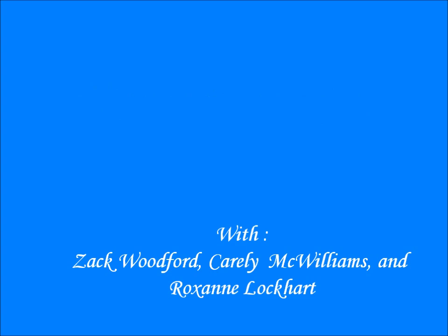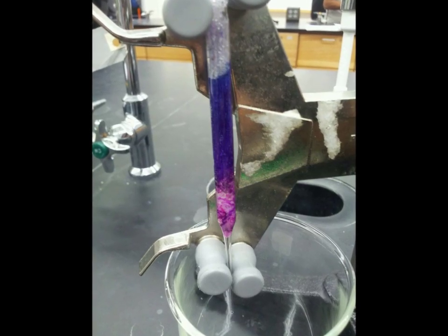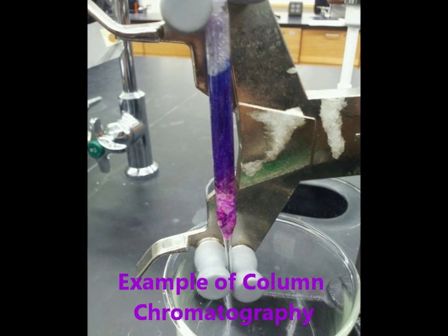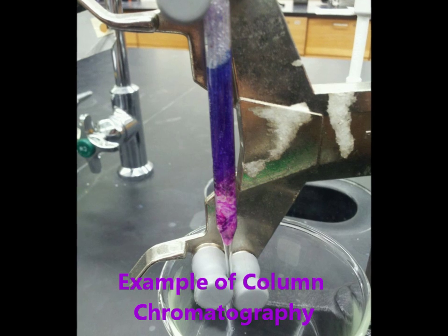Chromatography comes from the Greek word for colored writing. It is the most widely used analytical tool for separating a mixture and identifying its components. All separations occur by distributing a dye between two phases. The first phase is stationary and the second phase is mobile.